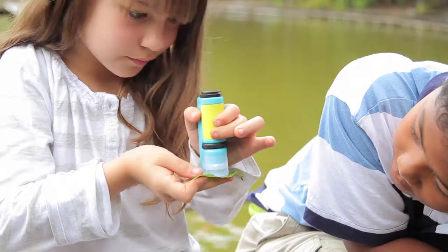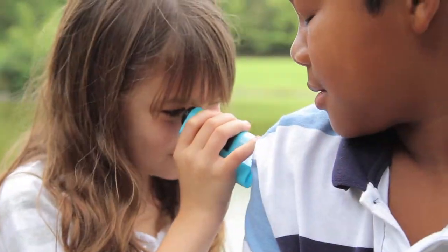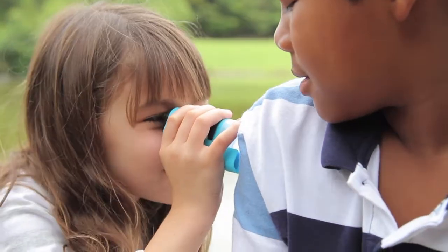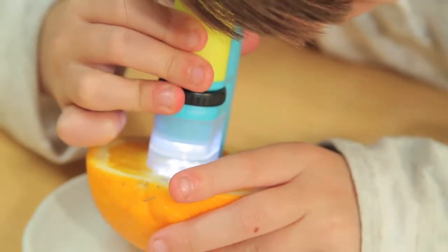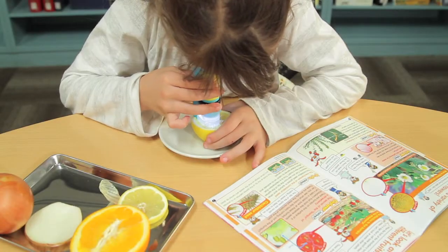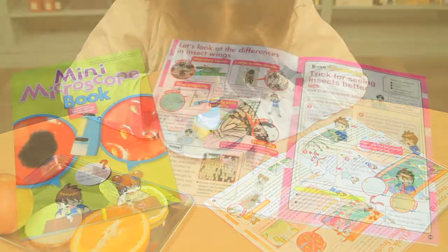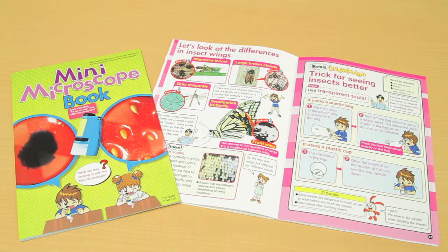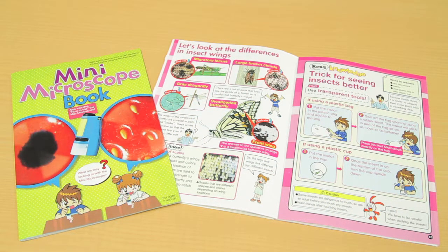Make new discoveries by looking at plants and insects, as well as paper, cloth fibers, vegetables, and fruit. The accompanying booklet introduces many items that will be interesting to observe. Have fun exploring the wonderful microscopic world with the Mini Microscope.